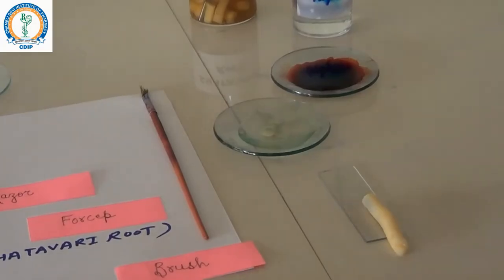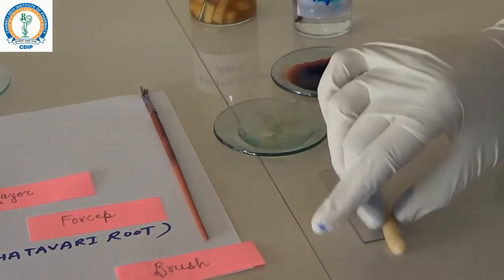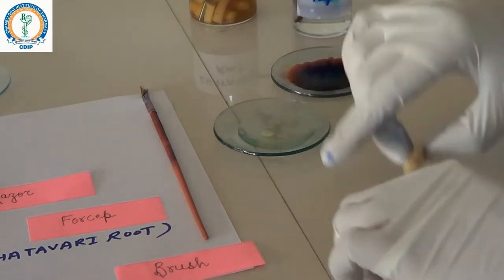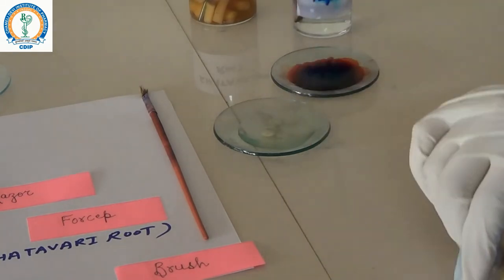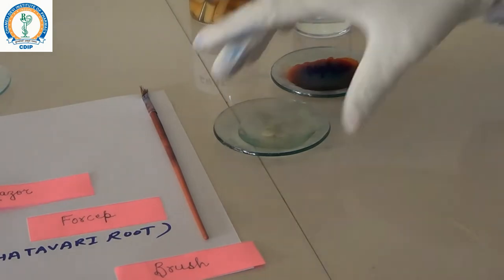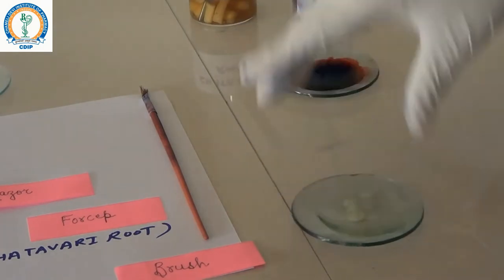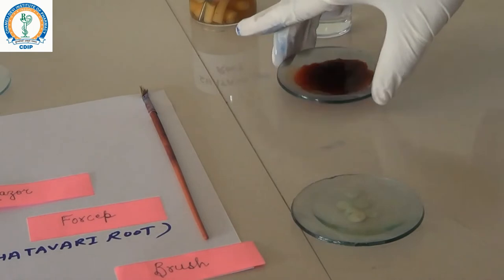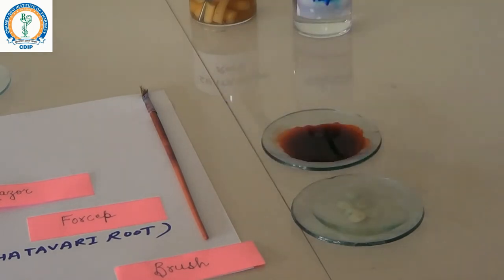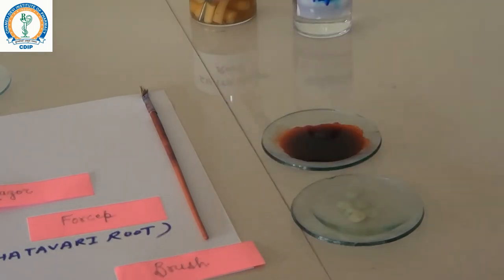After cutting the section, we will collect a sufficient quantity of sections in fresh water contained in a watch glass, and then we will select a very fine section of Shatavari root with the help of a brush.